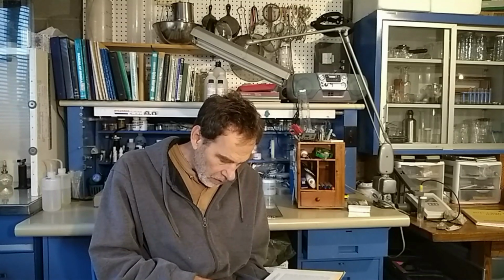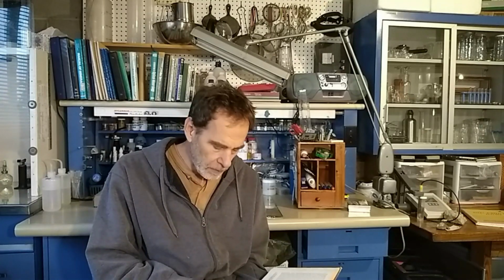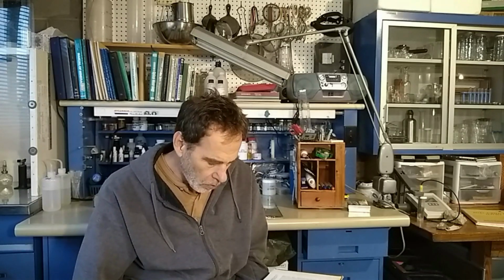Now the lead looks like it has the biggest indication. The first one, with ammonium carbonate, should turn white. The second, ammonium sulfide, should turn black, and the last one, the potassium iodide, should turn bright yellow, which is kind of the confirmation test for lead. So anyways, that should really tell us what we need to know. So that should be pretty painless. Here's a photo of that table for your reference.